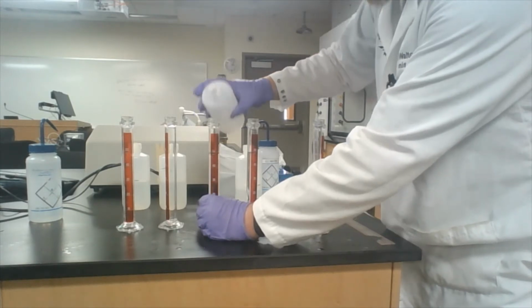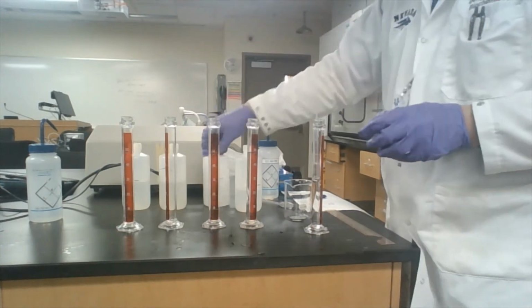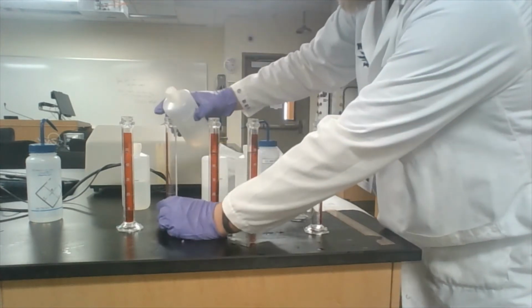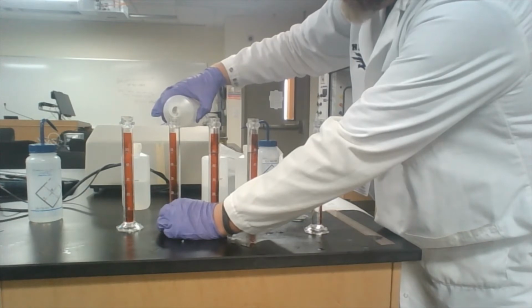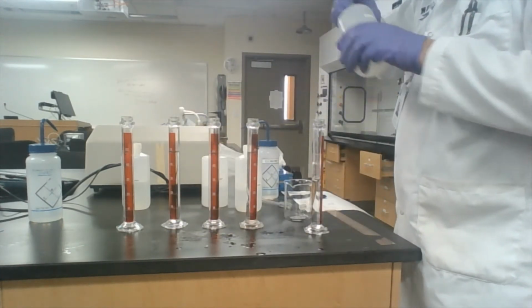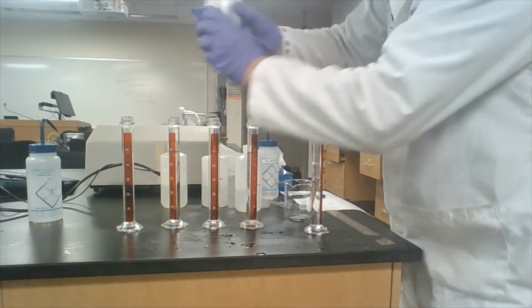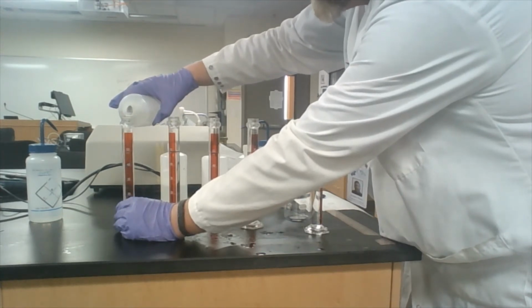We're going to use these measurements to build a standard curve. And then based on the results of our unknowns, we should be able to predict what the relative sugar concentration is by comparing it to the results that we get from knowns. This is a standard analytical technique to use knowns to build a standard curve and then to compare your results to a known. Now, it's not completely accurate because there are other things that may cause buoyancy, but for purposes of this course, it will suffice in terms of giving us a more or less accurate picture of the relative buoyancy.